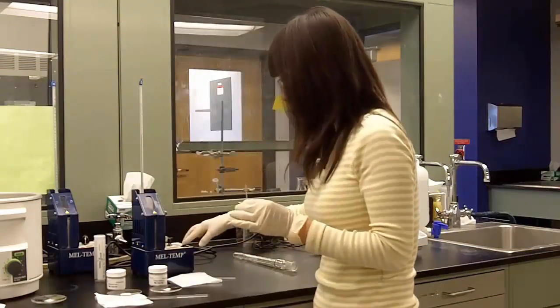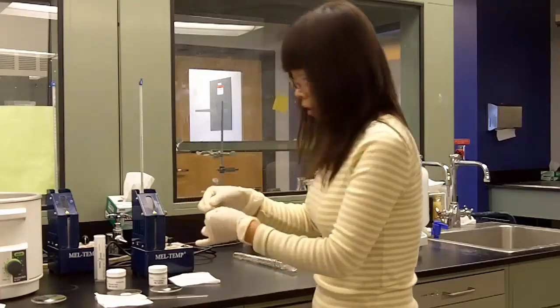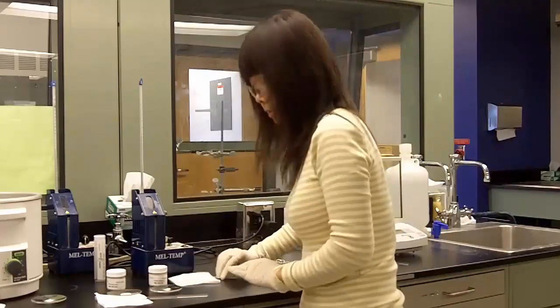After you finish everything, always make sure you turn it off and throw away the used melting point capillary tubes to glass disposal and clean up the desk.